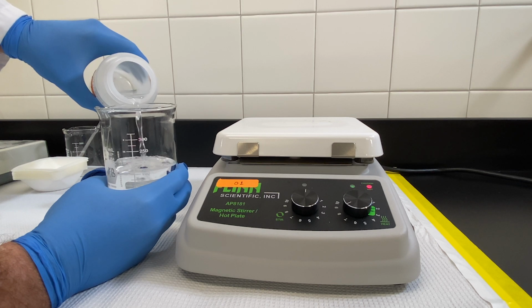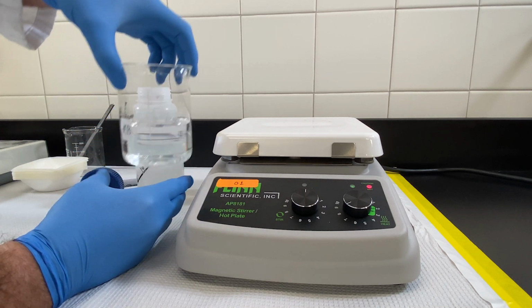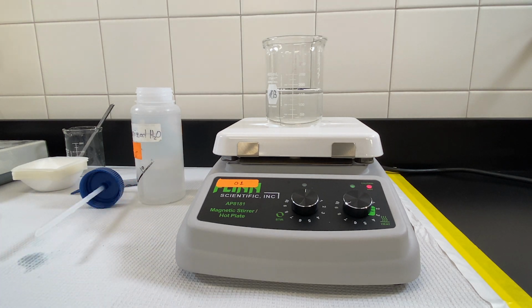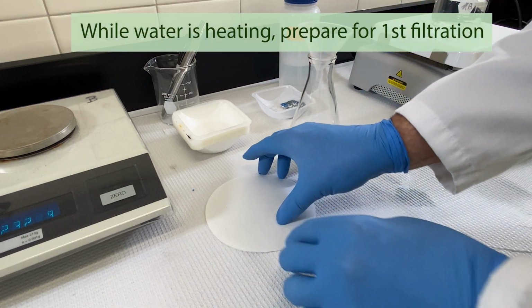Then what we'll do is we'll put our mixture in the hot water. Some of the materials will dissolve, some of them will not. For the ones that don't dissolve, we're going to need to filter that. And so while the water is boiling or coming to a near boil, we'll go ahead and prepare for that filtration.